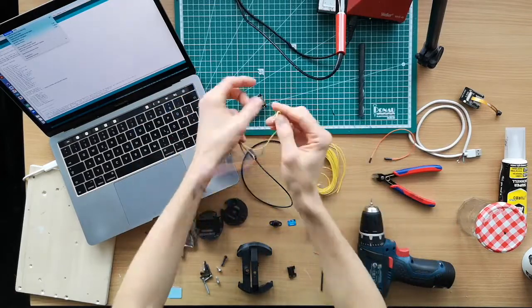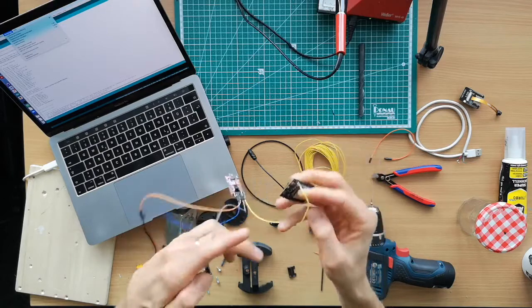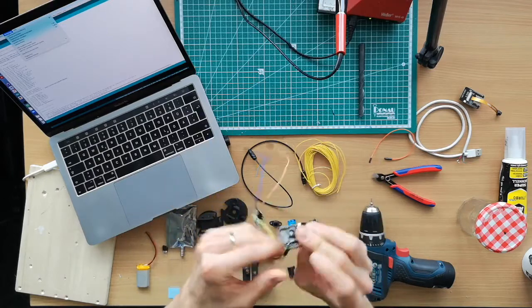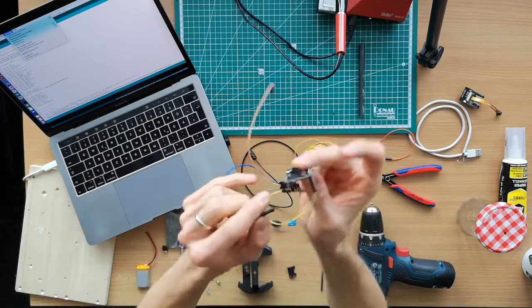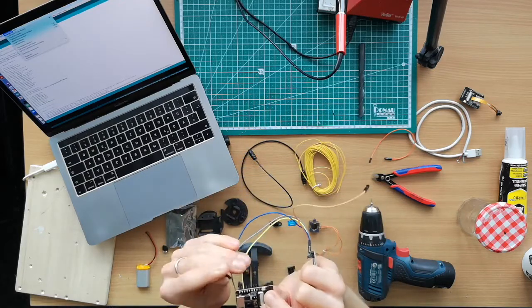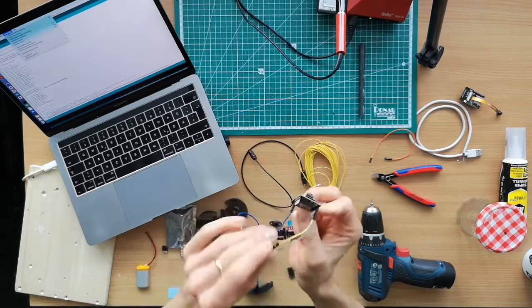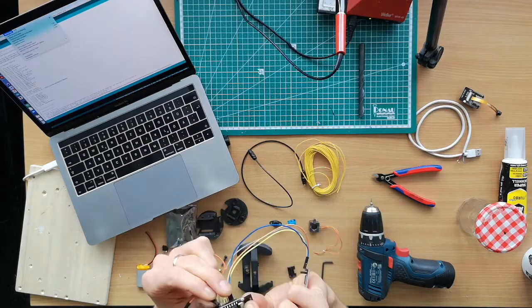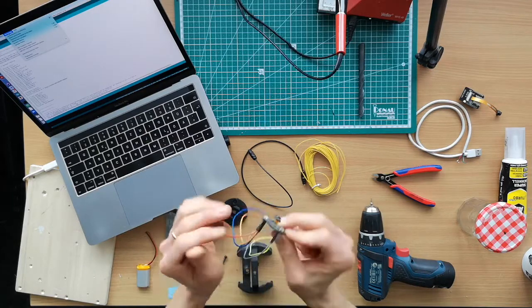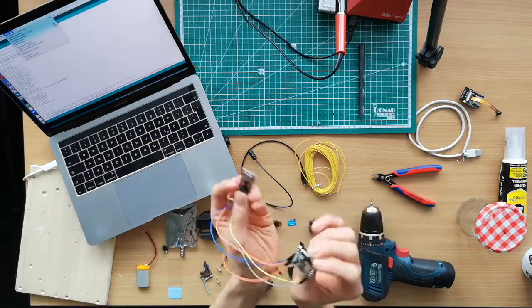So this is ground, so the yellow goes to ground. Then the 5 volts belong here. Well, I'm always messing it up. So the R receive goes to U transmit, which is right here. And then the other one goes here. And then in order to enable booting into the flash mode, you also have to shortcut ground and pin 0. And then you plug this bit into your computer.